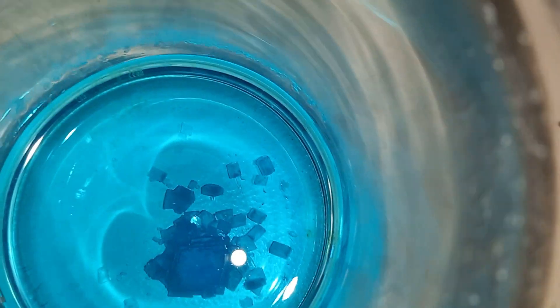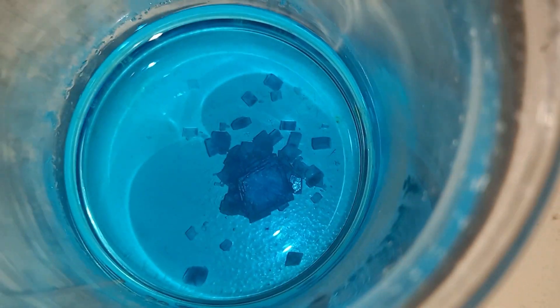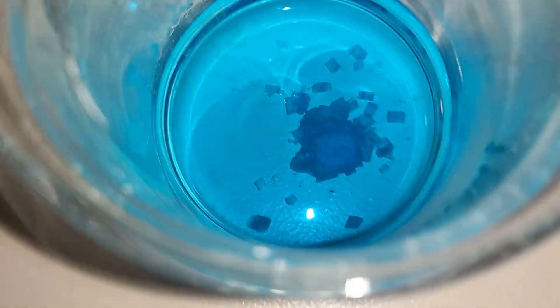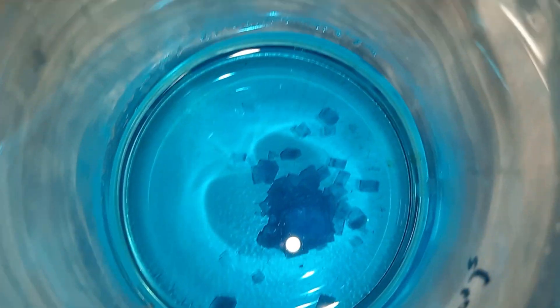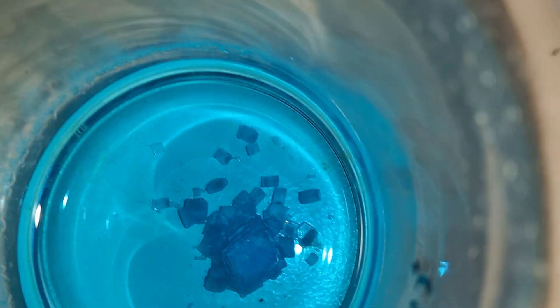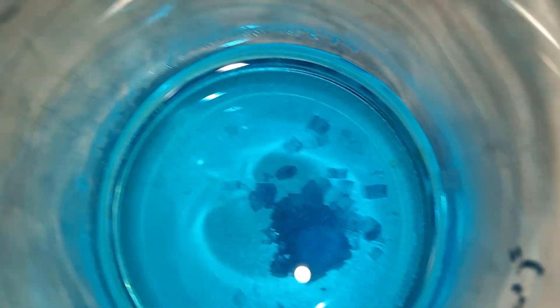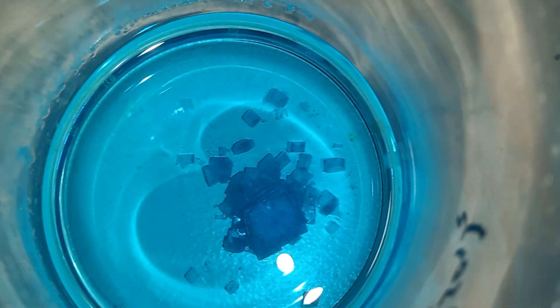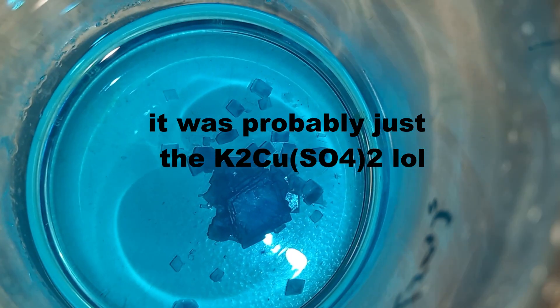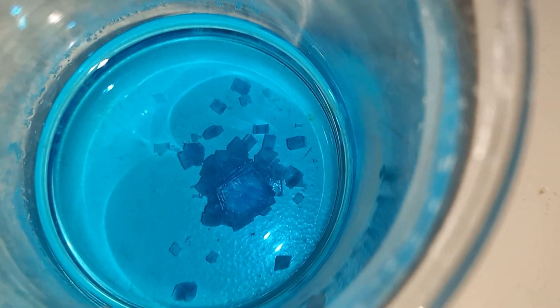I still don't know what the weird precipitate was, but it may be my product because I tested its solubility in water and it seemed almost insoluble — so I figured it was probably carbonate or something. But it was actually soluble in this solution, which is very weird. I really don't know what it is. But I think I succeeded in creating the substance anyway.